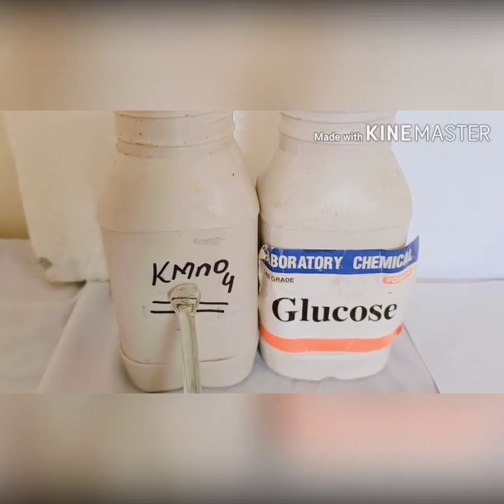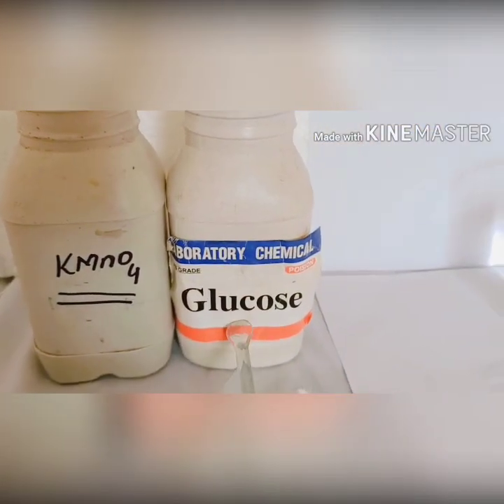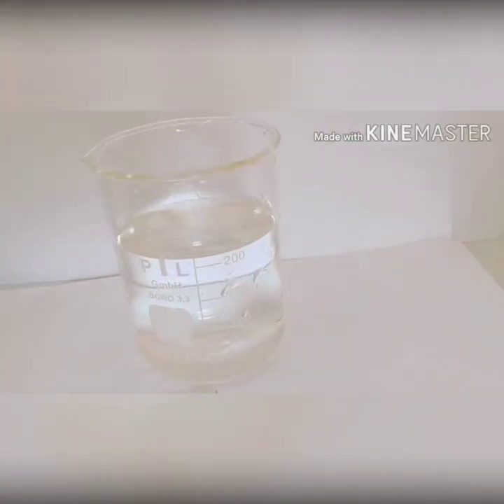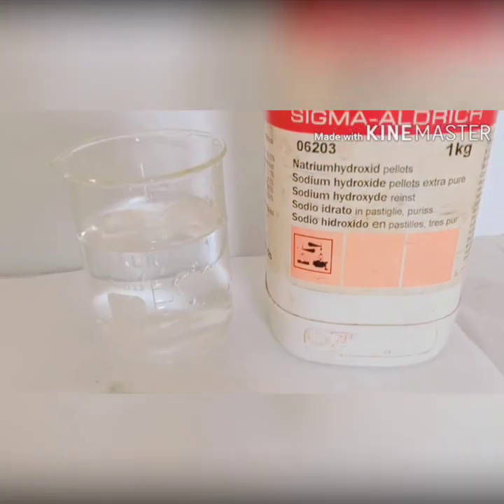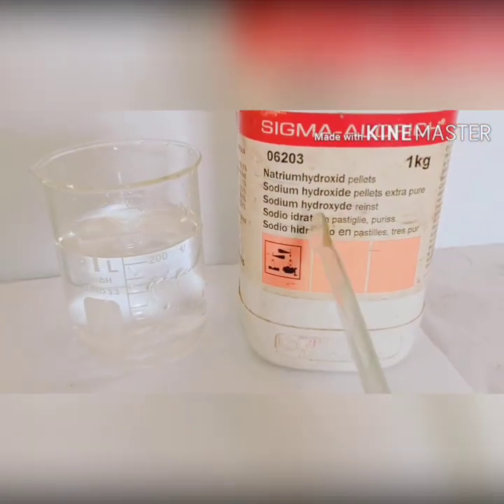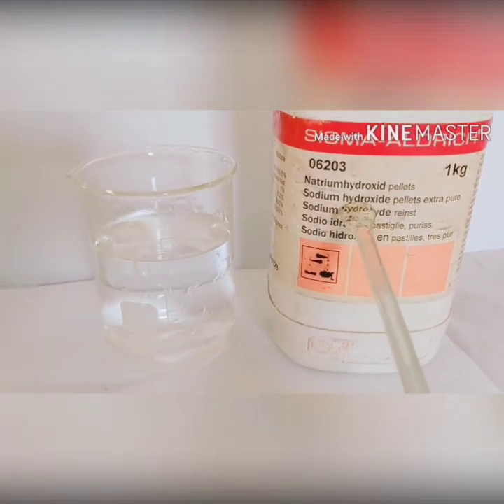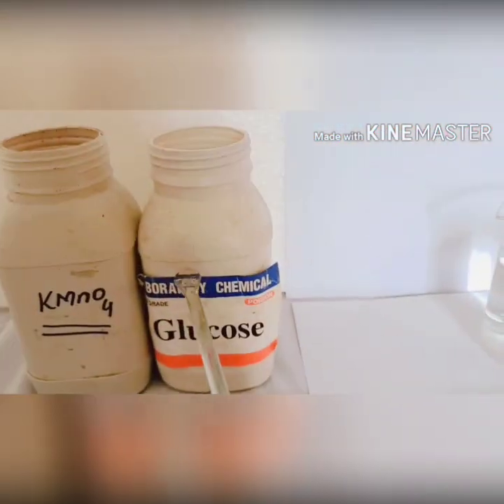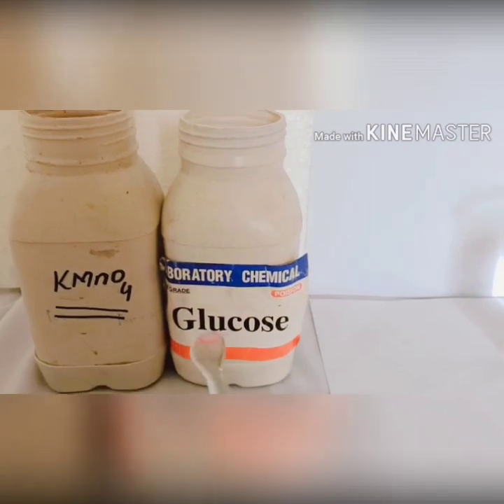Hello guys, I hope you all are fine. Today we are going to discuss the oxidation state, specifically the oxidation state of manganese in potassium permanganate. For this purpose, we will take some chemicals to perform this experiment. As you can see, here we have sodium hydroxide, glucose, and potassium permanganate.